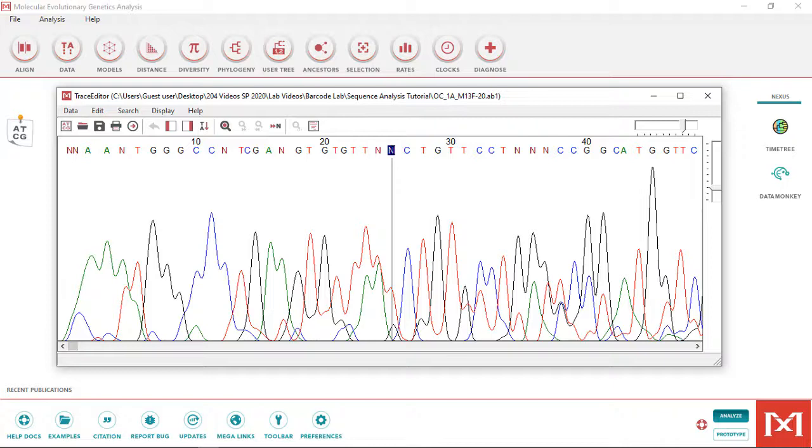This is common at the ends of the sequence, very near to and far from the primer being used to sequence the DNA. We're going to trim the low quality sequence at either end and see if we can confidently assign nucleotides to any remaining N's in the sequence. Now in this sample, this N is the last ambiguous call at the beginning.